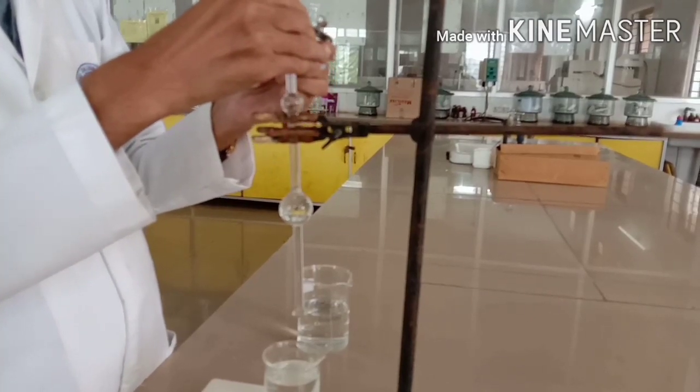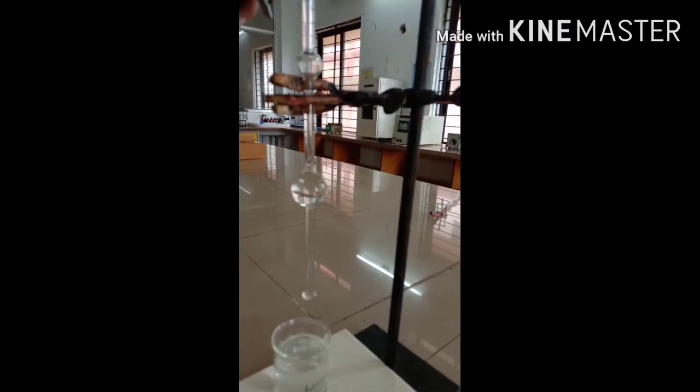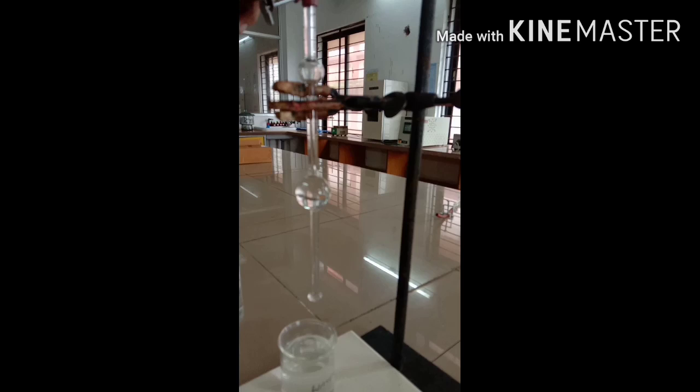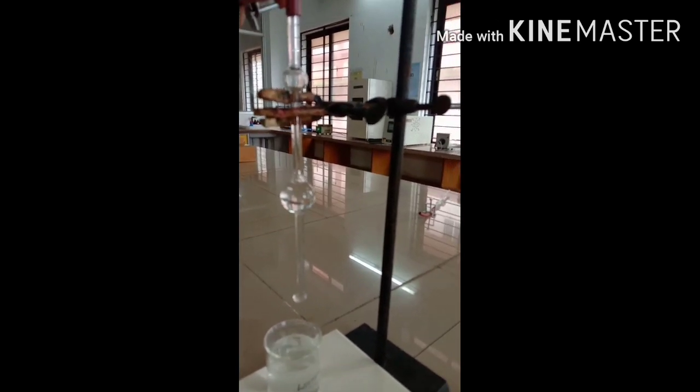The drop should be 10 to 12 drops per minute. Once again, suck the liquid without changing the adjustment.